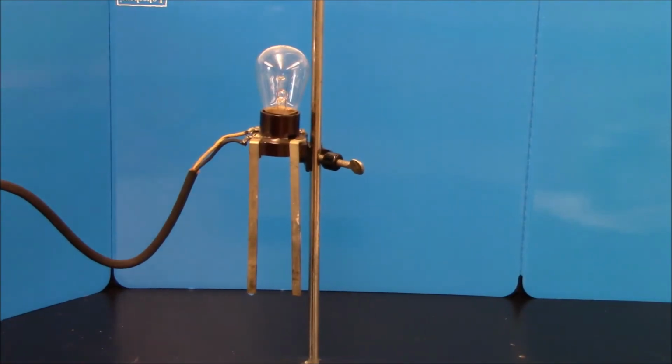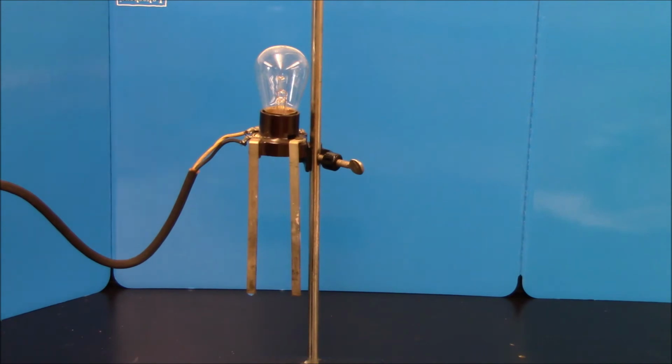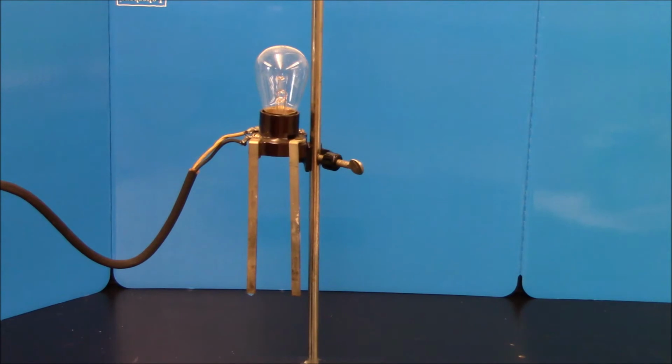So what we're going to do now is test a variety of substances. I've got some strong electrolytes, I've got some weak electrolytes, I've got some non-electrolytes. And what we're looking for is a general amount of brightness. The brighter this is, the more ions. The conductivity tester, or the light bulb, does not care what the identity of the ions are. What it cares about is the number of ions. So this is a pretty qualitative demonstration.